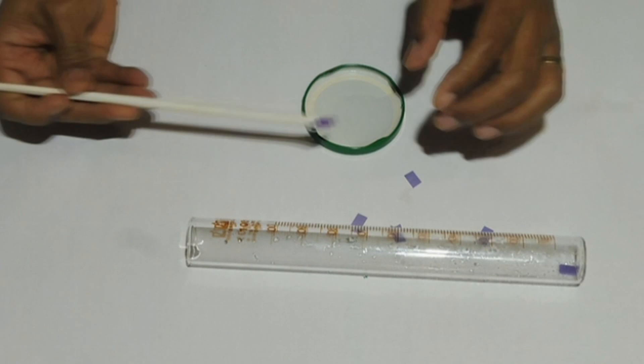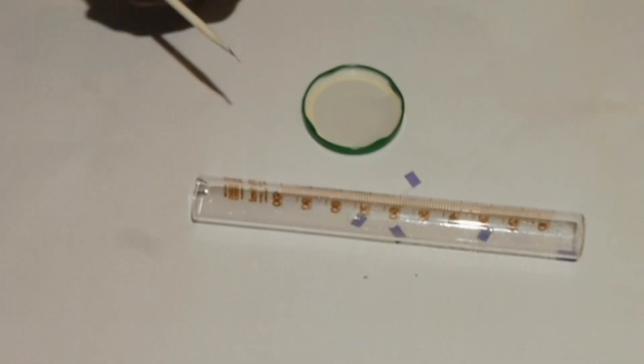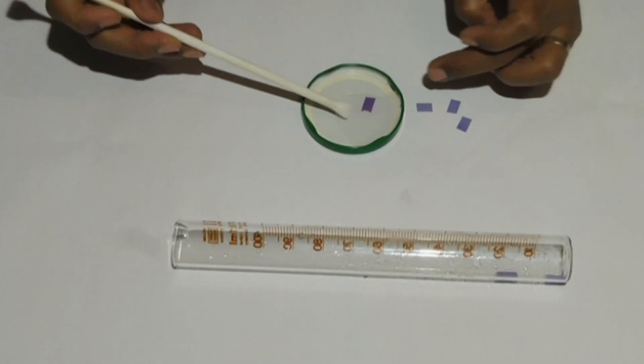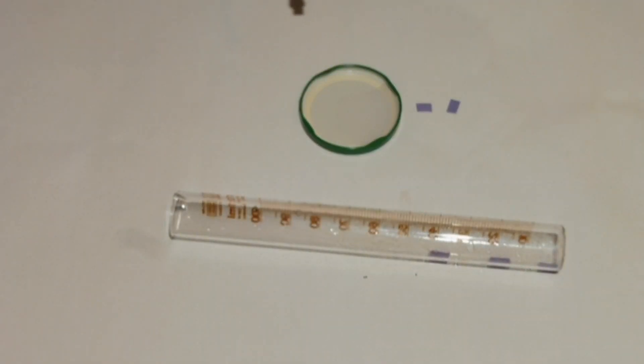Do the same for the remaining five pieces, but this time placing them at equal intervals in the direction towards the opening of the cylinder.